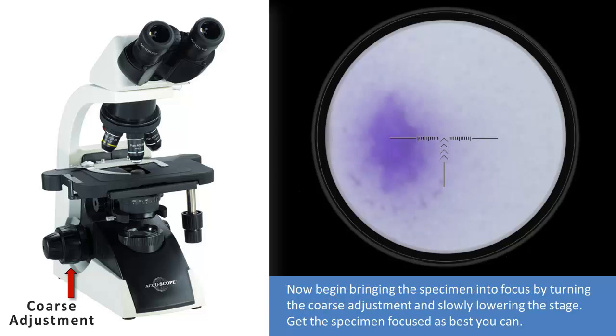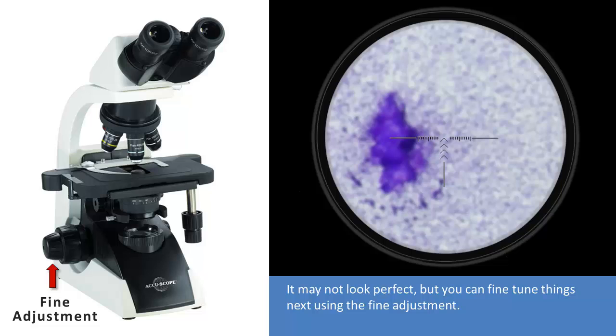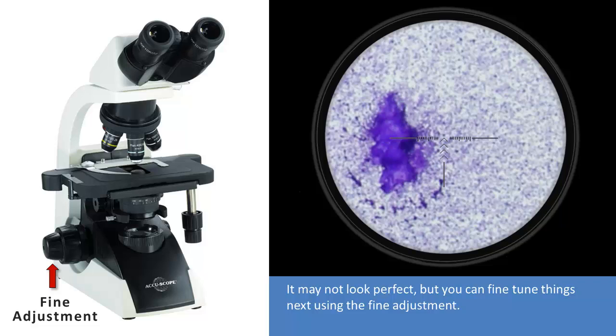Now begin bringing the specimen into focus by turning the coarse adjustment and slowly lowering the stage. Get the specimen focused as best you can. It may not look perfect, but you can fine-tune things next using the fine adjustment. There, that looks pretty good.